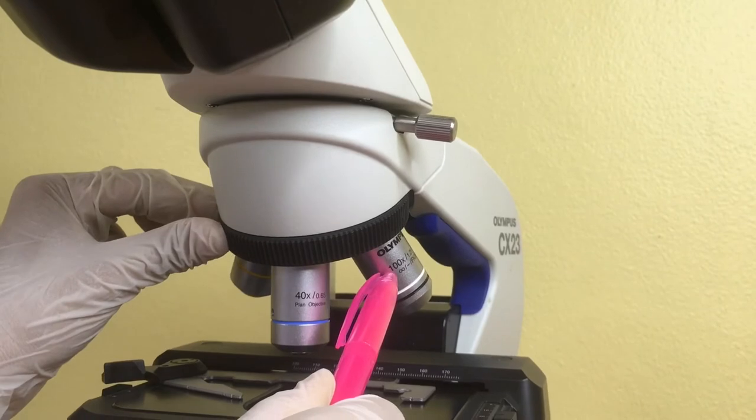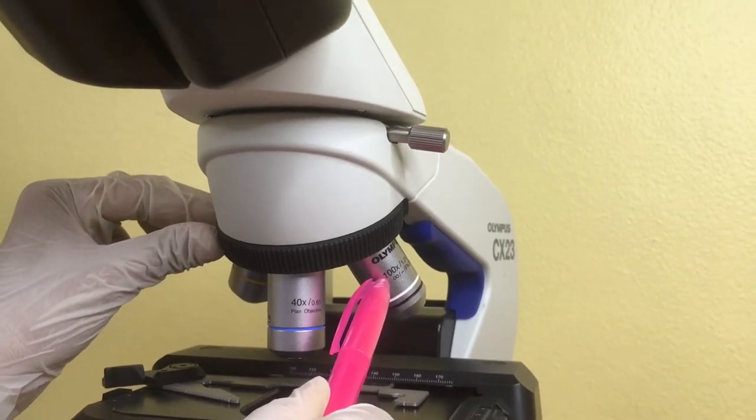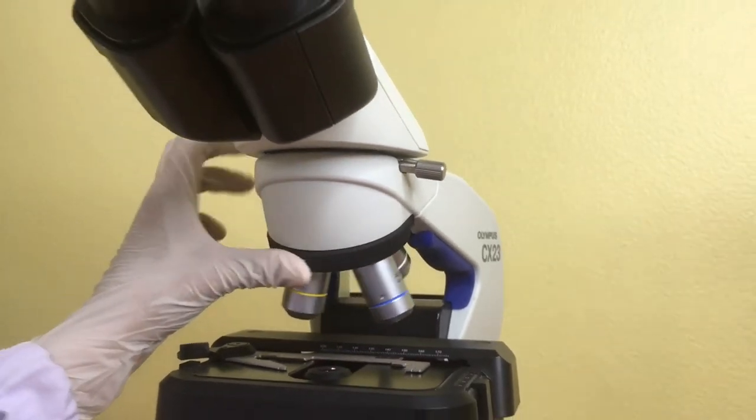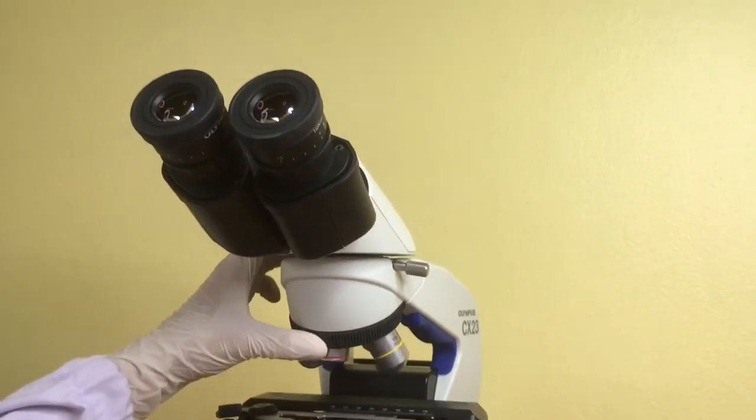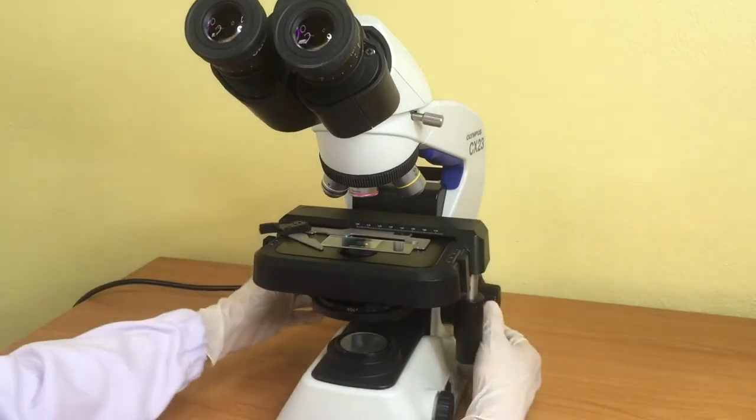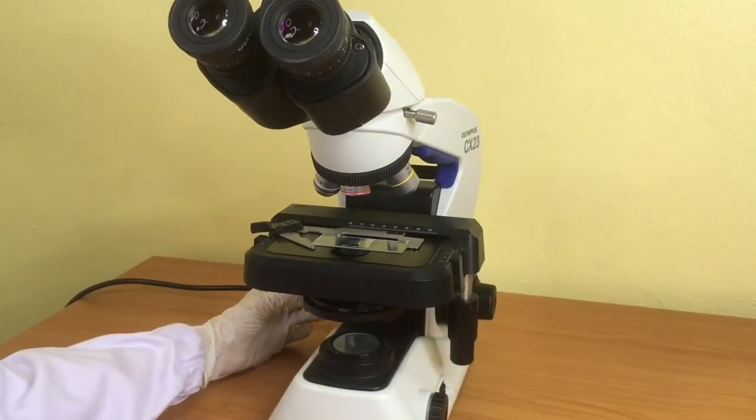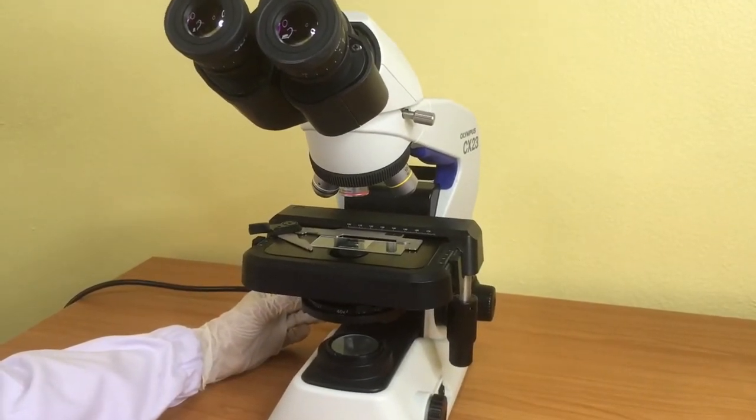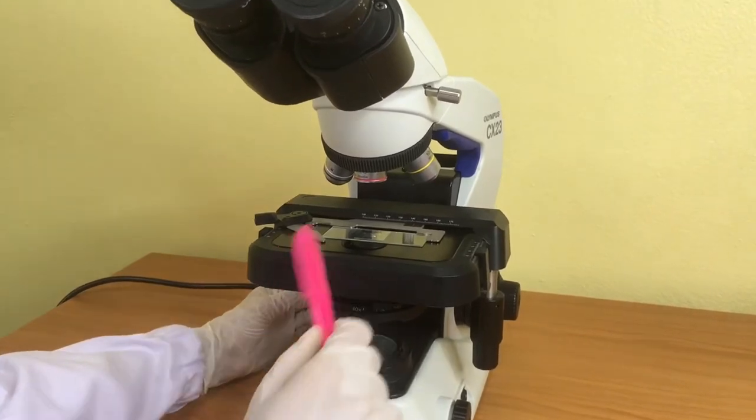When you use the microscope, make a good focus at the lowest magnification before changing to higher magnifications. If you want to zoom in to see more details, you need to change the objective lenses to higher magnification.